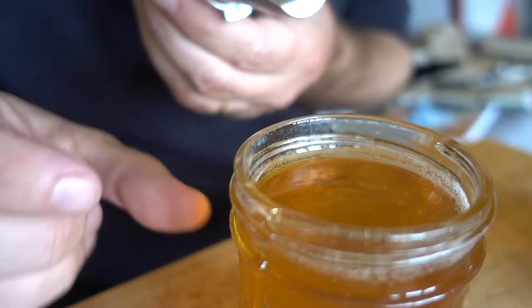So here we go, actually that looks pretty good, let's see what we got, yeah it's slightly over 71.